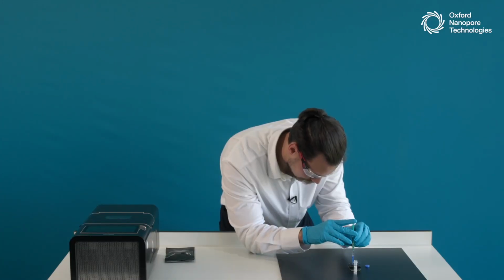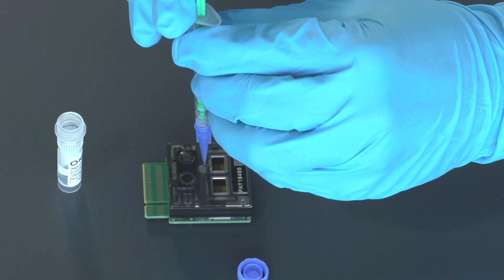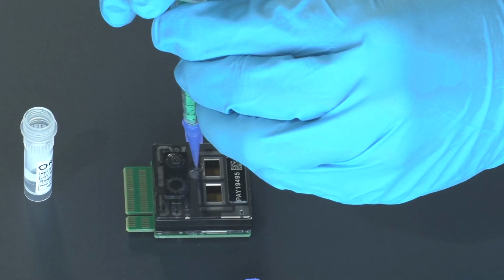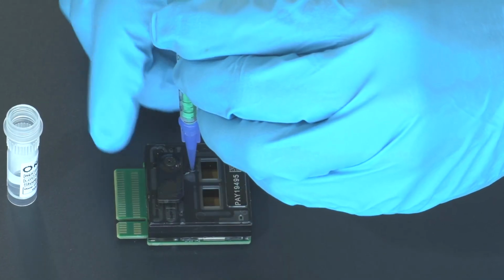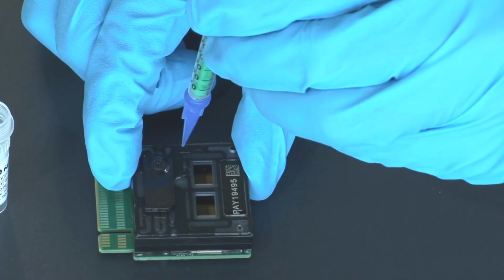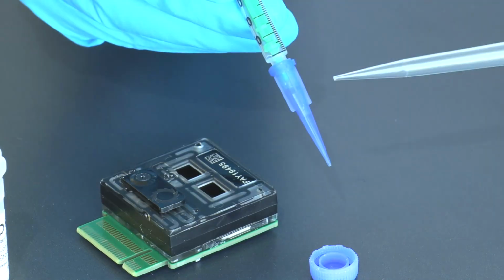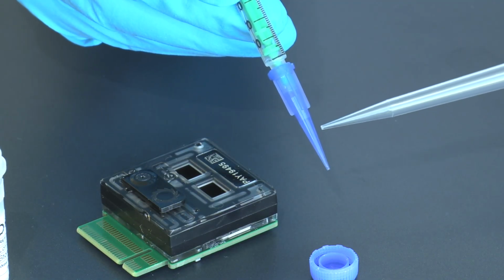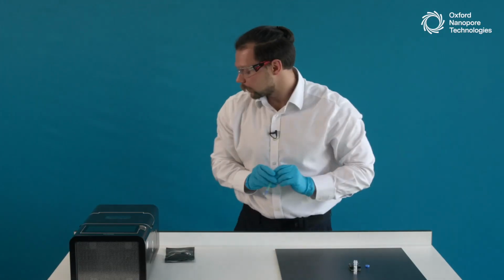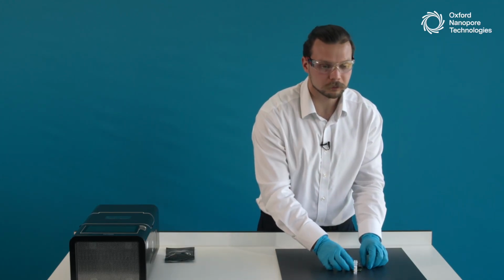and carefully press down onto the plunger until the level of liquid reaches somewhere in the middle of the pipette tip. As always, it is okay to leave a little bit of liquid in the tip, so we can disconnect it. We can disconnect the tip, and as you can see here, I'll show it a bit more. There is still some liquid, some priming buffer left inside. I will let everyone finish with this part. And we have done the first priming step.